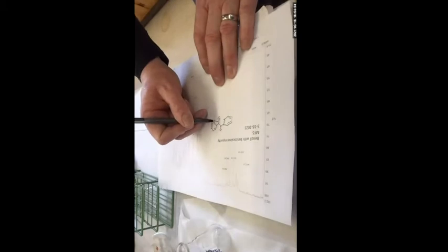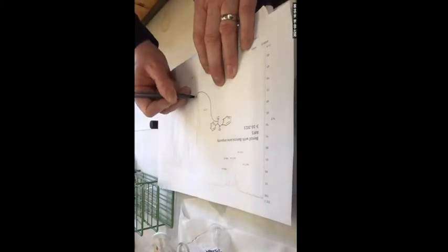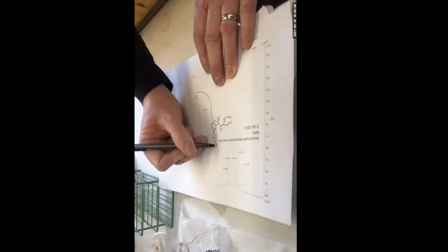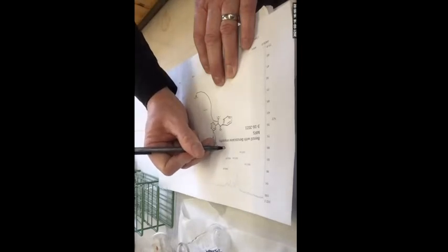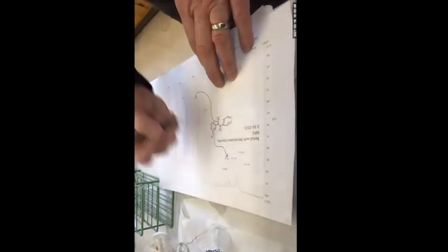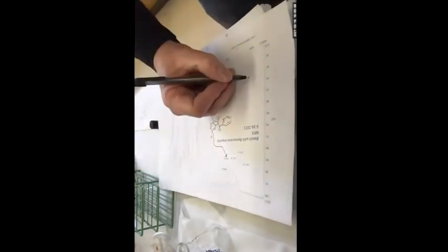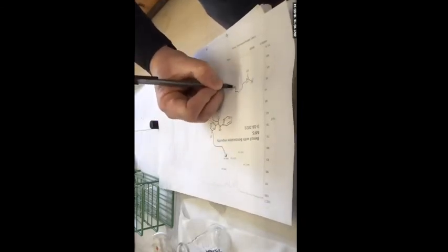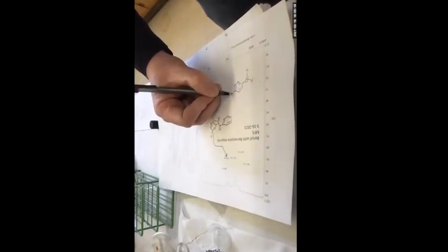And I think the carbonyl is here, and the sp2 carbon hydrogen is here, just over 3000. I don't know if this is readable for you guys? Yeah, we can see it a little bit, not the numbers really, though. I'll take a picture of it and I'll add it to the final video too.